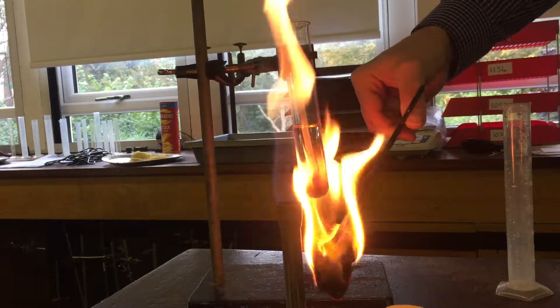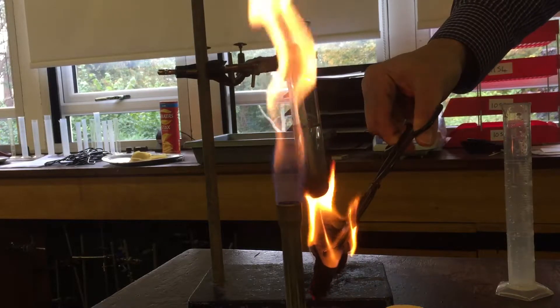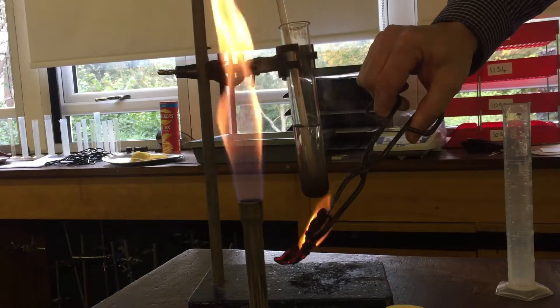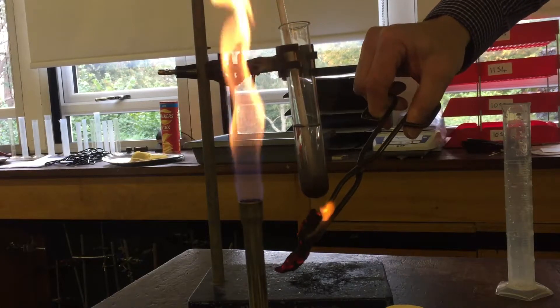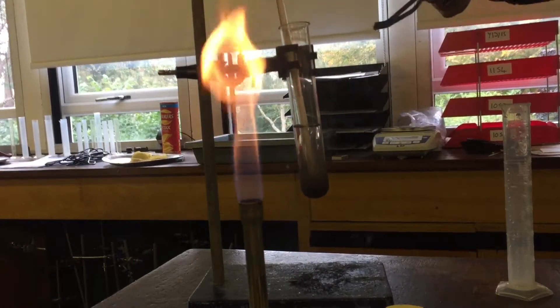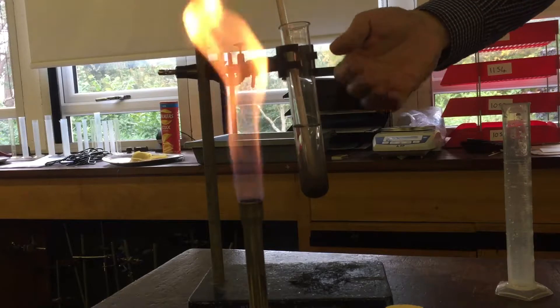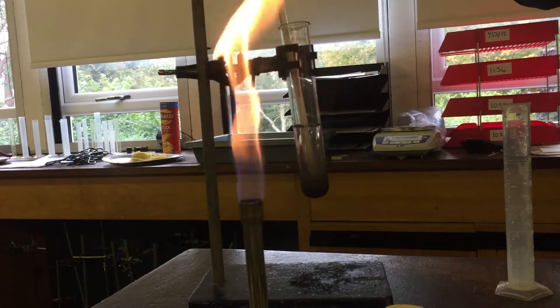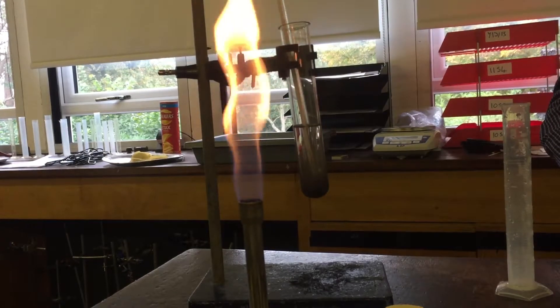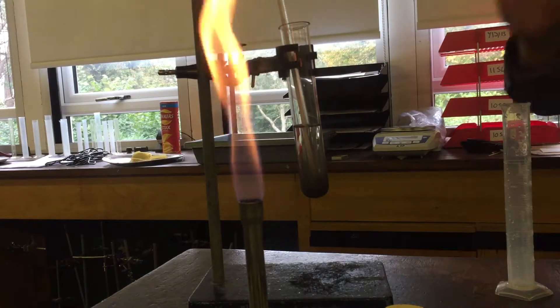Keep burning it until it's gone out, continuing to rotate so the flames go up. Once burnt out, give it a little while because energy is still being transferred from the tube into the water. Look at the temperature, and when the temperature stops going up, take your readings. If it keeps going up, wait for the point where it doesn't go up anymore — so far it's still going up, it's about 41°C.